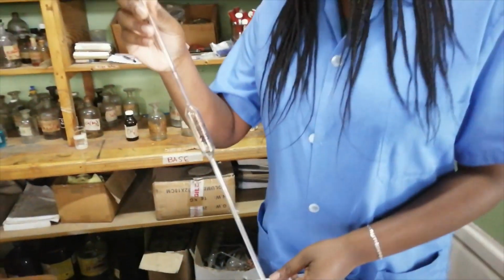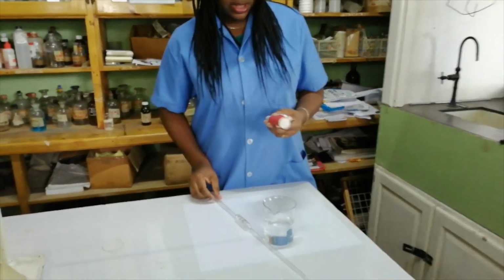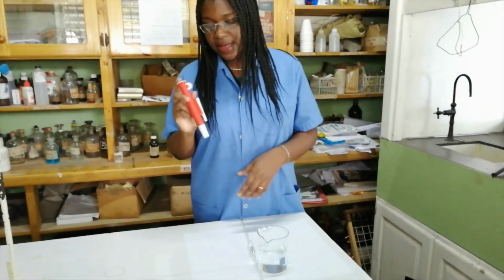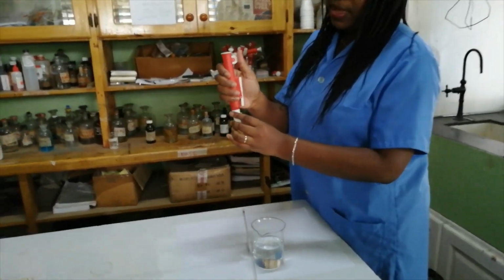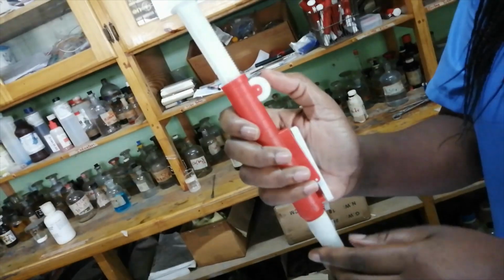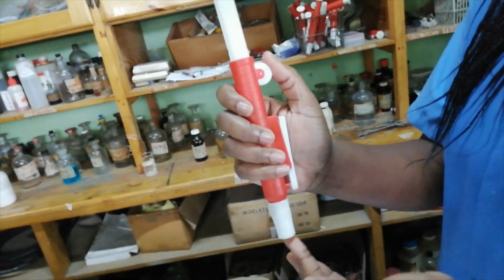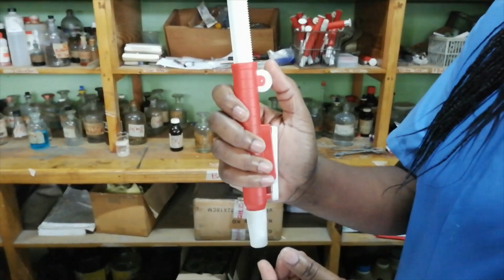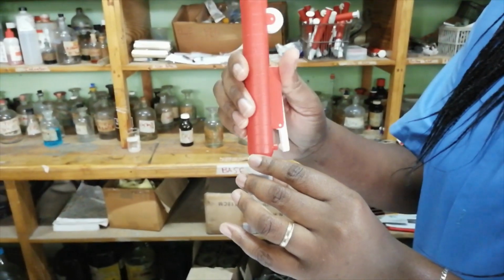So I'm going to do a transfer for you. But before I do that, I'll talk about the pipette filler that you'll be using in the lab. This pipette filler right here, we have a wheel and you roll it down so that this goes up. When this is going up, there's a suction force that is created with the pipette that will pull the fluid in the pipette. If you want to release the liquid in the pipette, you press this lever right here.